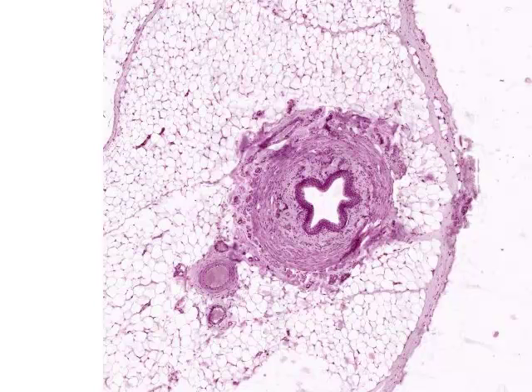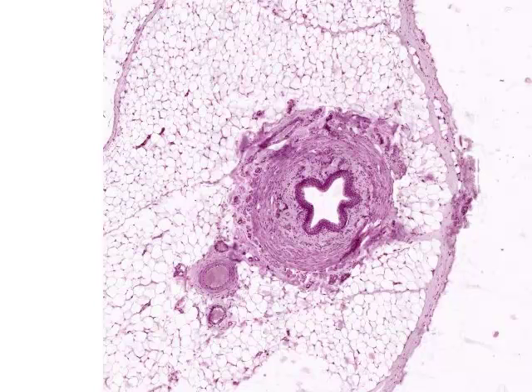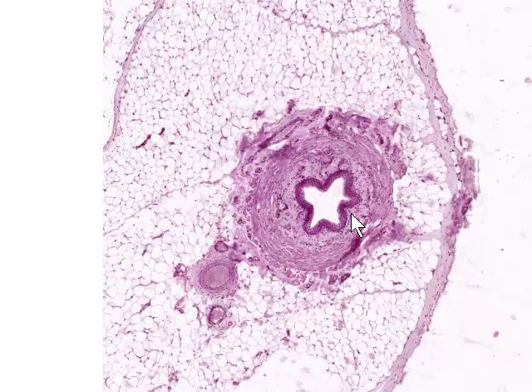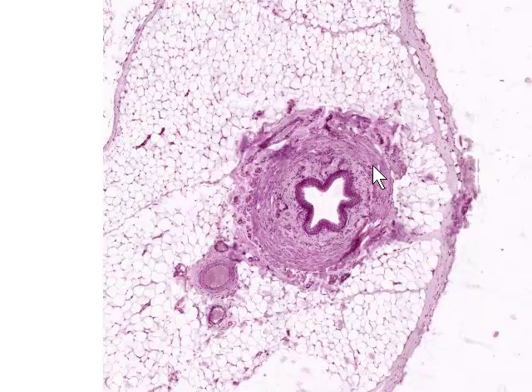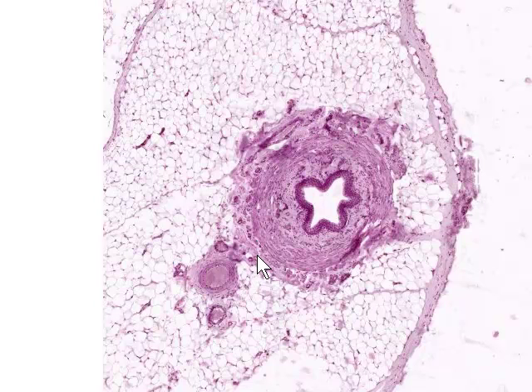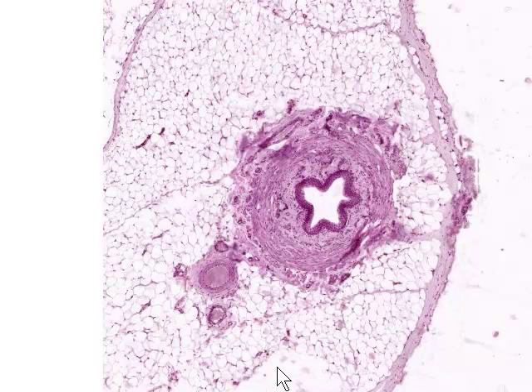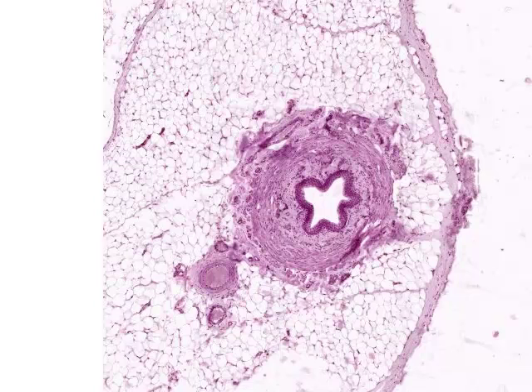Here's a slide of the ureter — a relatively narrow muscular tube that leads from the renal pelvis and carries urine to the bladder. We can see the ureter itself, with the lumen forming a kind of star shape. It's lined by urothelium that we'll see in more detail in a moment. There's some connective tissue beneath this, some dense connective tissue, and then several layers of quite thick smooth muscle that make the ureter quite contractile. On the outer part we see blood vessels supplying the wall of the ureter, a large ureteric artery and possibly ureteric vein. The whole structure is embedded in a fat pad.